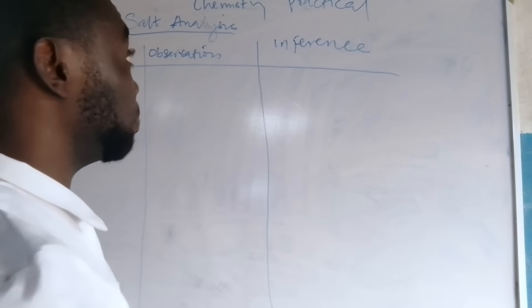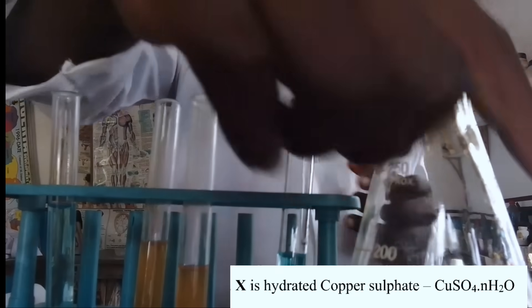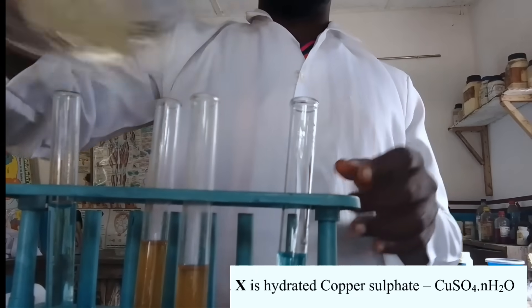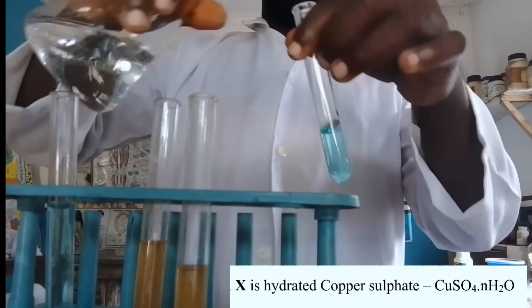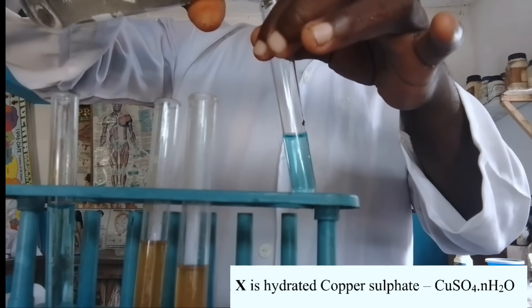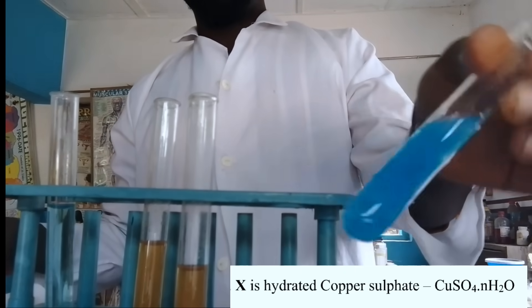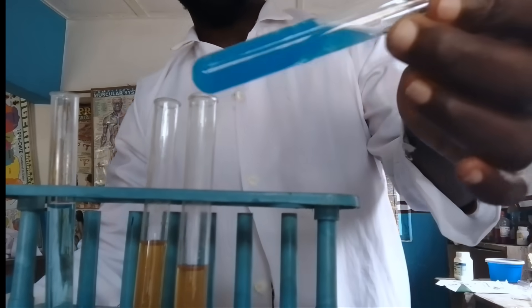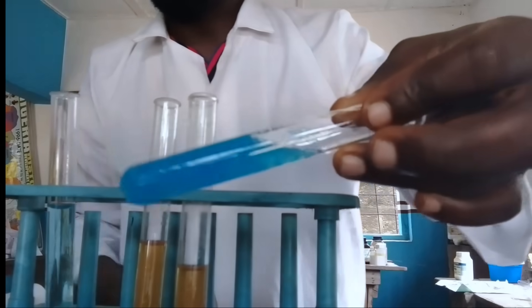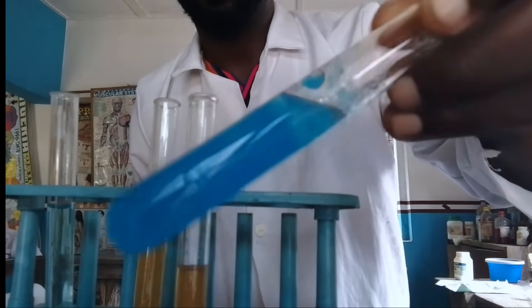We are going to be testing sodium hydroxide against the copper sulfate solution. This is our sodium hydroxide and this is our copper sulfate. We are going to add some drops of this into this and take our observation. Now if you look at it very well, you will discover that it has a blue jelly precipitate.